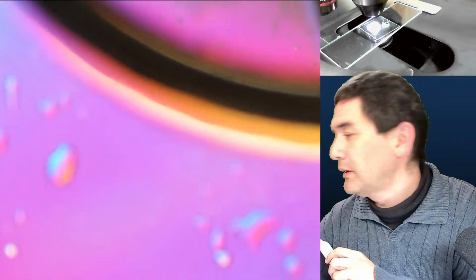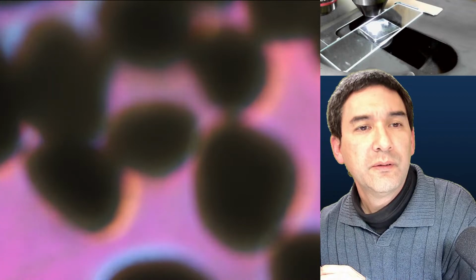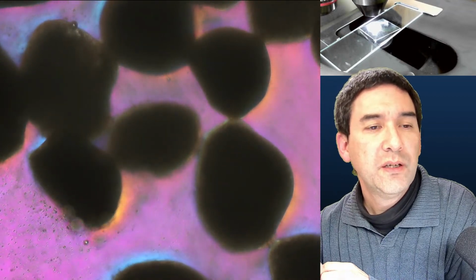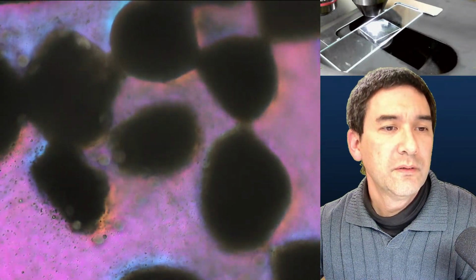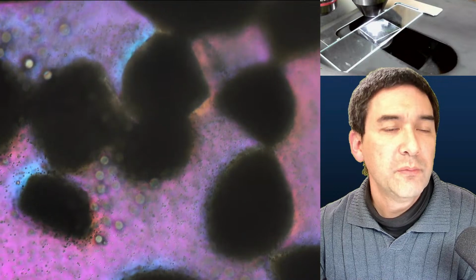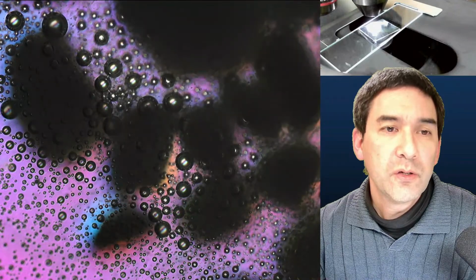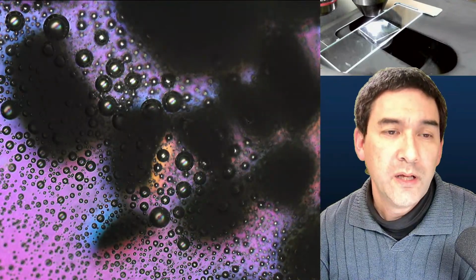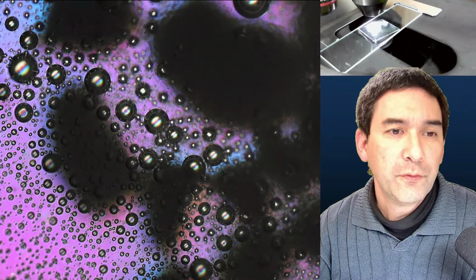Okay, here it touched it. Oh, okay. It's going. Well, I need to add a little more maybe, because as it's starting to. So now we can actually see it dissolve. And it looks like there are bubbles coming off, right? So maybe it is indeed air that is trapped, or maybe, here are lots of bubbles, right? Or maybe indeed carbon dioxide, I don't know, right? Because it's carbonate, so maybe it forms hydrogen carbonate, and then you also have carbon dioxide forming.